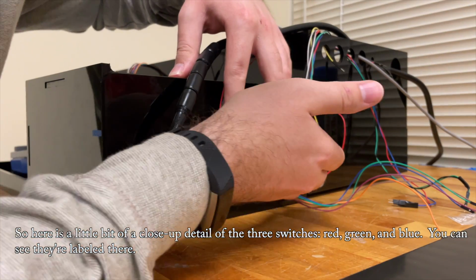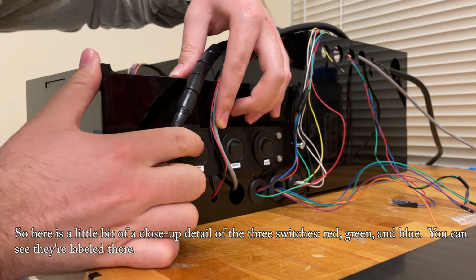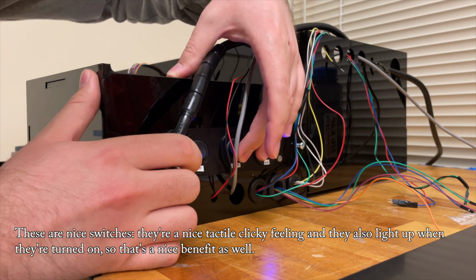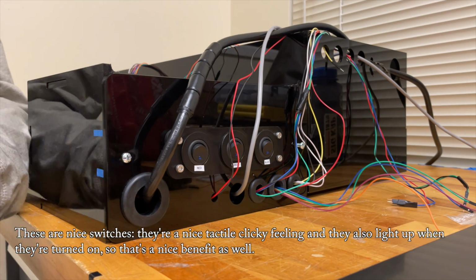So here is a close-up detail of the three switches, red, green, and blue. You can see they're labeled there. These are nice switches. They have a nice tactile, clicky feeling, and they also light up when they're turned on, so that's a nice benefit as well.